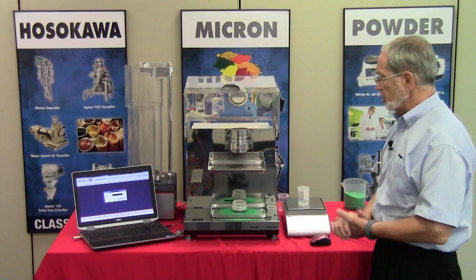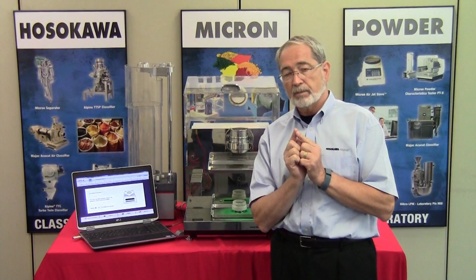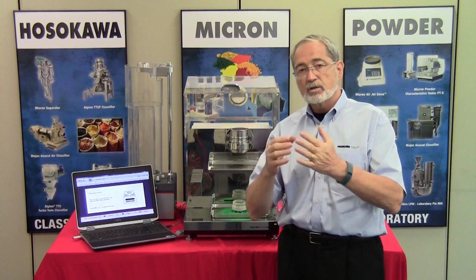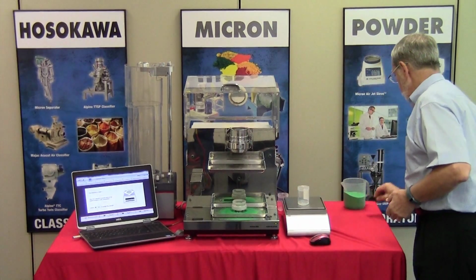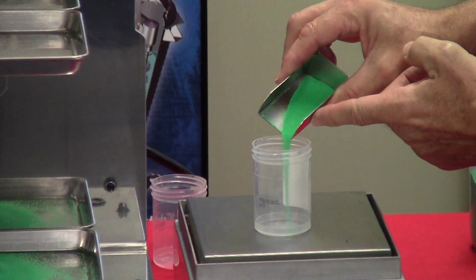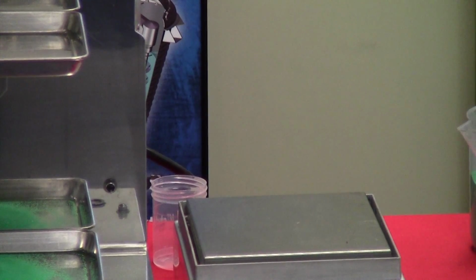We're now going to tare it as if there's no weight there. And in this case here, the software indicates that we want to take a 2-gram sample. What's nice about the PTX, we have the flexibility with the PTX and the software to be able to vary the sample. So what we'll now do is we'll just take some of this material and we will measure it out. Oh, I've gone way over. So let's take some of that out.